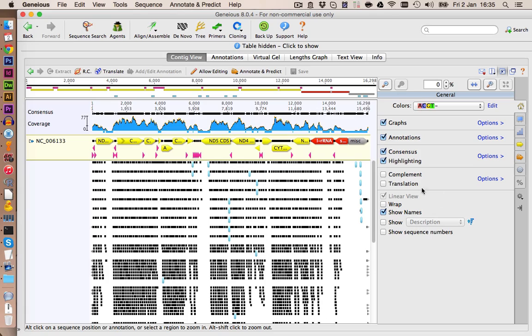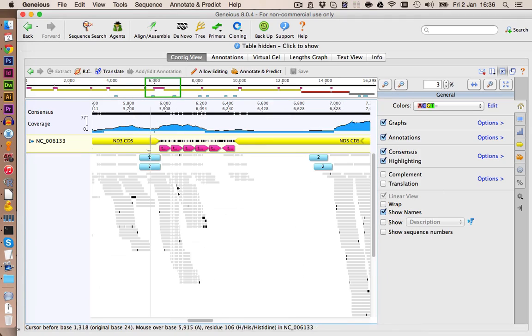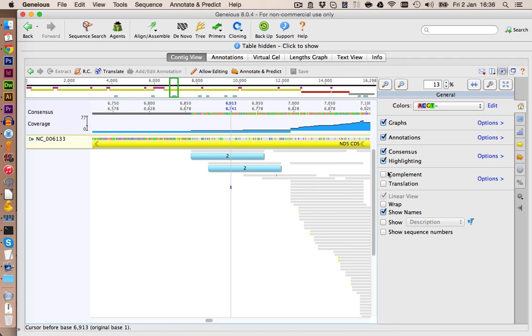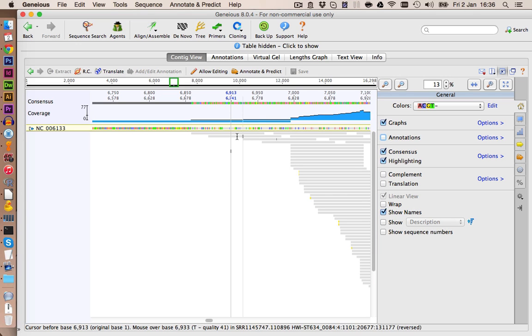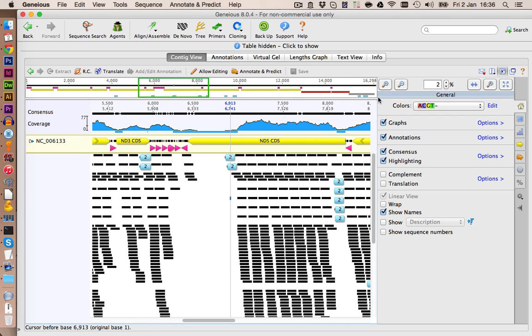Let's take a closer look. We have some hits which are assembled here and here. So this doesn't matter much, but this is very nice, as long as the hits are looking okay. Let's also disable annotations, but those two hits here, they were added and they look really good. So that's nice. Also here in an area with low coverage, additional hits were added.